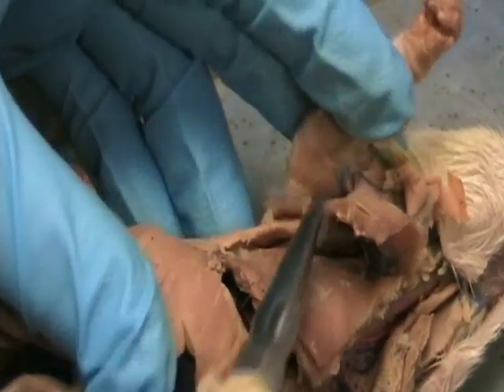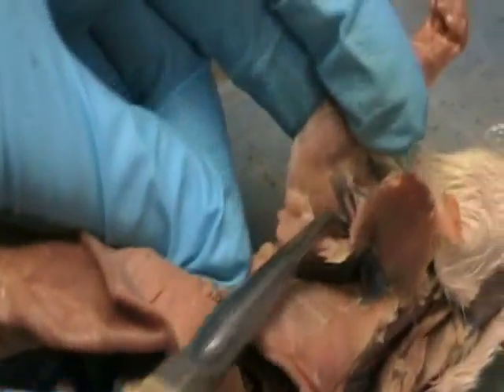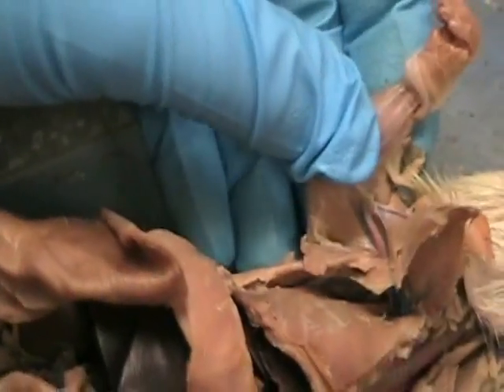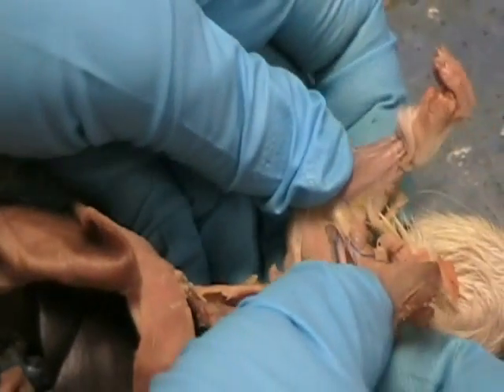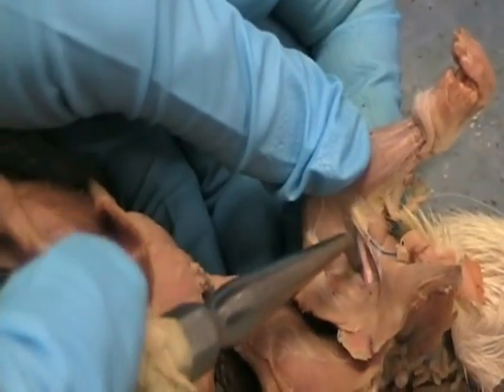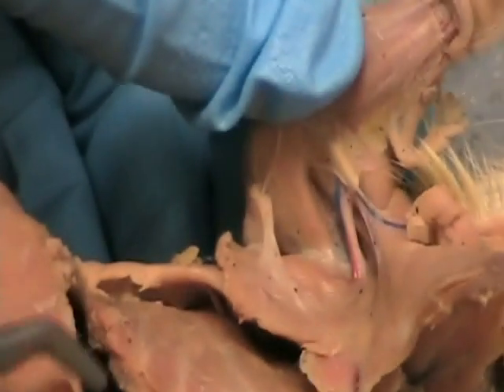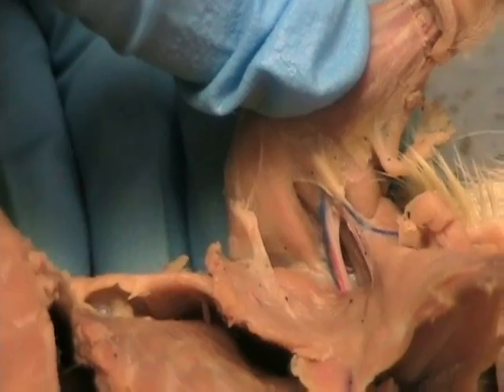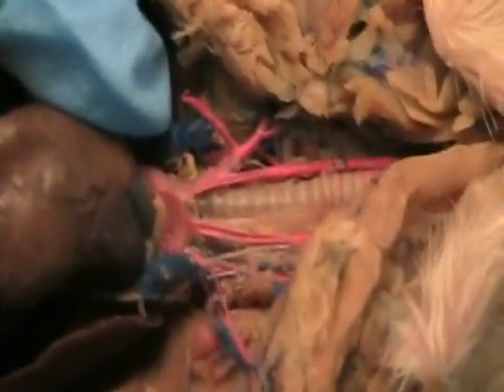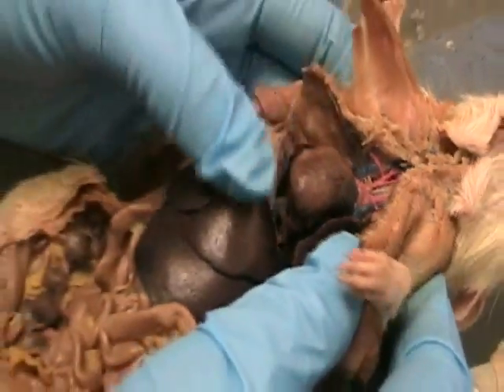Okay? The other branch will eventually go all the way to the arm. And you guys have seen this one before. This is called the brachialis artery. And I told you to look for a muscle underneath it. Any memories of what the muscle is underneath? Coracobrachialis. So this is the brachialis artery, or brachial artery. Okay? So that is the top part. And again, you should be able to find all the same stuff on the right side. Except for the brachiocephalic trunk.